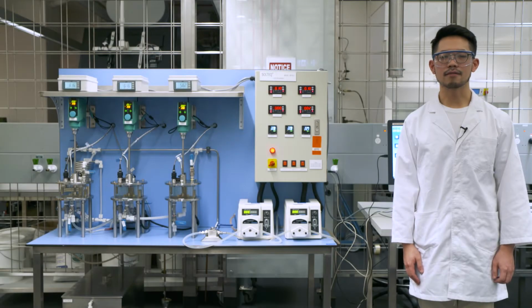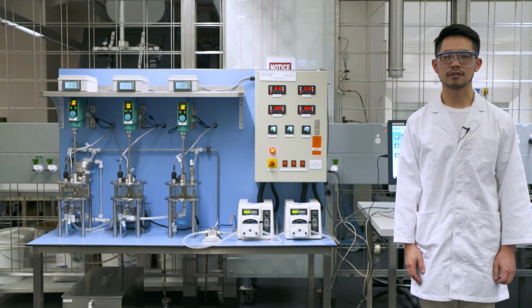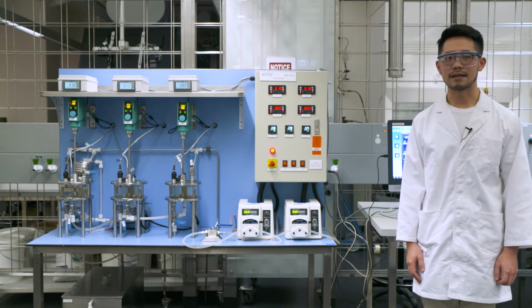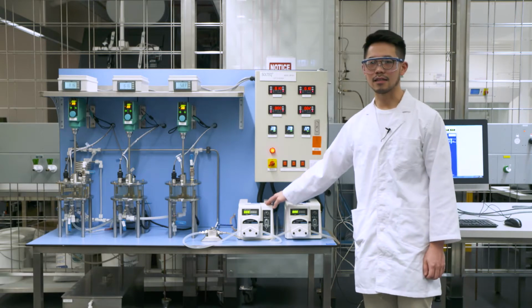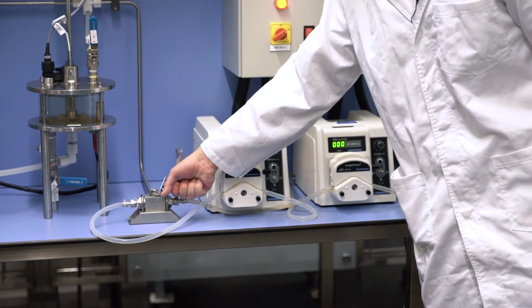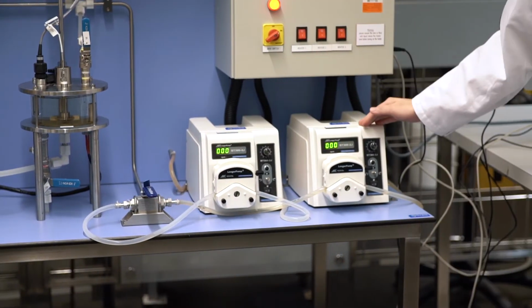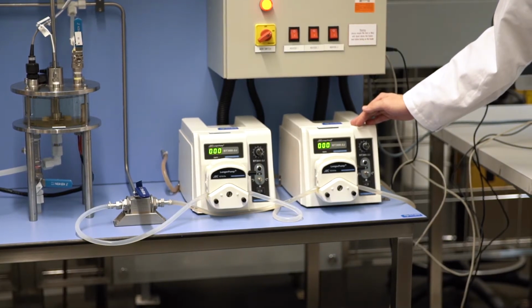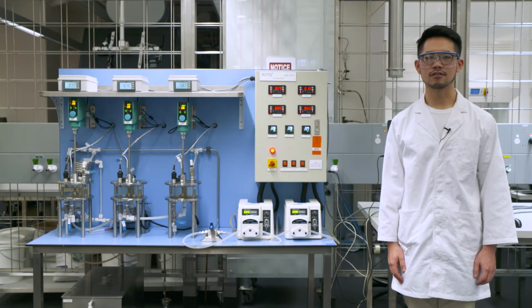During the operating part of the experiment, we will introduce a pulse input into our system. This will be achieved by introducing the brine solution into the CSTR. We will achieve this by first stopping pump P1 and moving the three-way valve V6 towards yourself, and then opening pump P2. The speed of pump P2 will be set at 45 RPM. After that, you need to start your stopwatch at the same time. We will do this for 2 minutes.